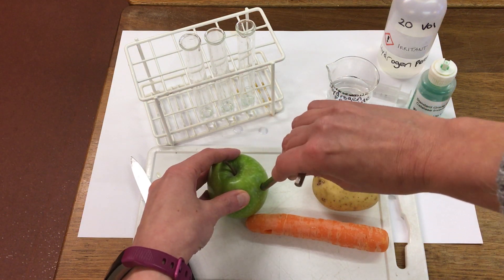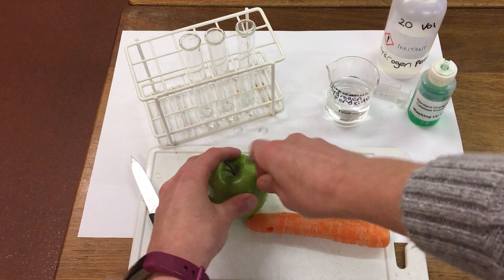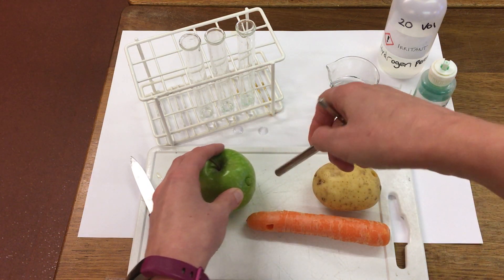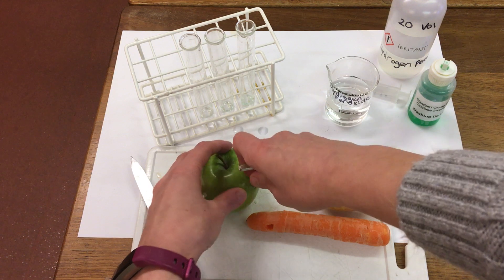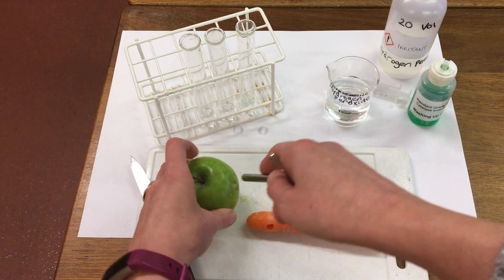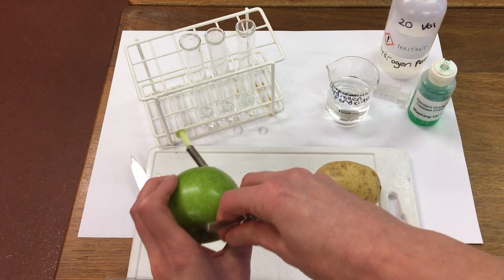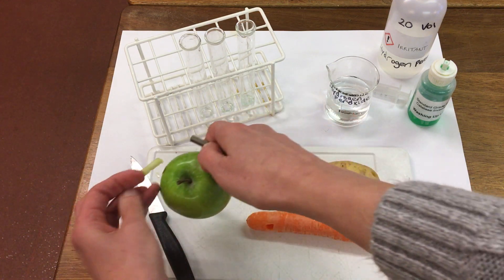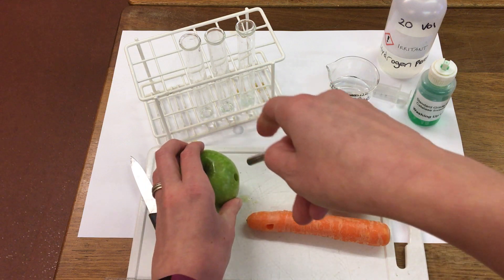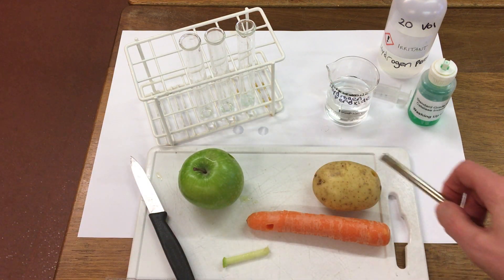First of all, apple. I'm using a cork borer here to take a sample, and then I'm going to cut each sample into 1 cm pieces.